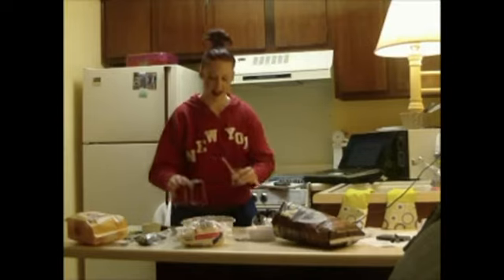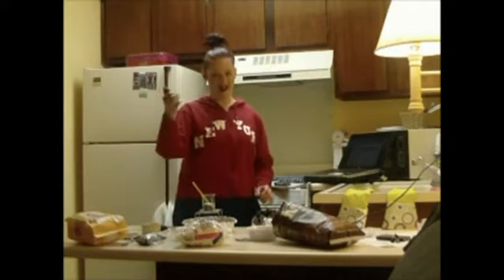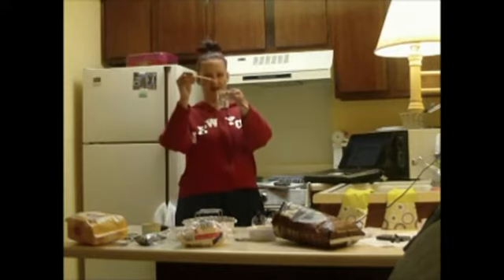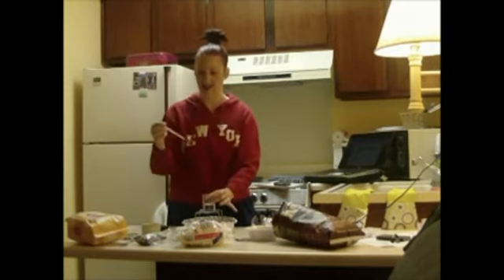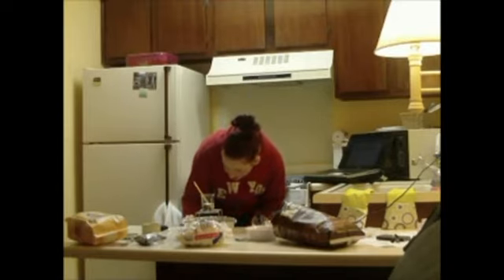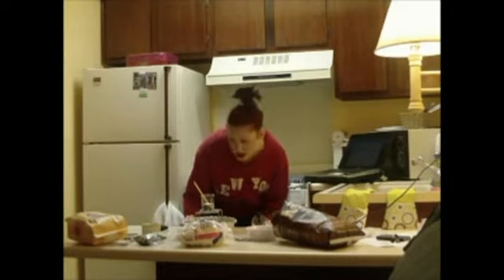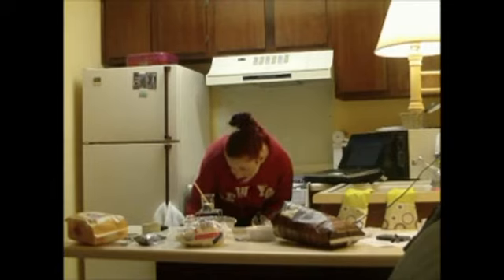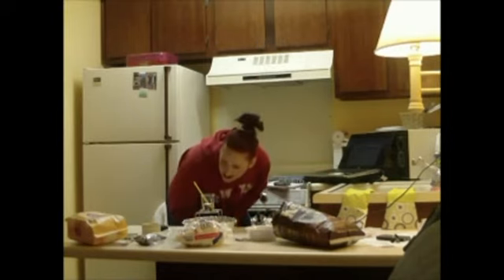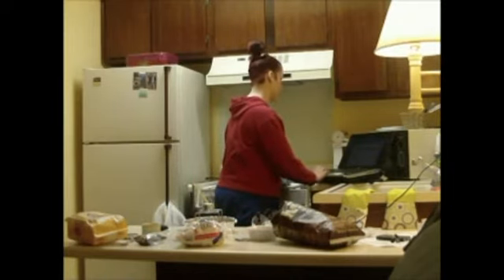And basically what I did was I already measured out some masses here on my little electronic scale. I've got an aluminum tin here with a little metal stand so I can burn things. And I've got 50 grams of water in here, and I've got a little thermometer with which I've measured the temperature of the water. I had the AC going, so it was 20 degrees Celsius before, but I must have really been blasting that AC. It's really more like 16 degrees Celsius.